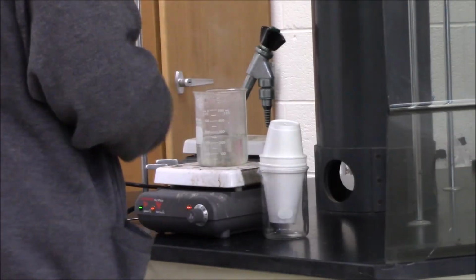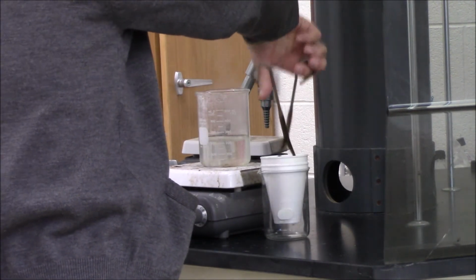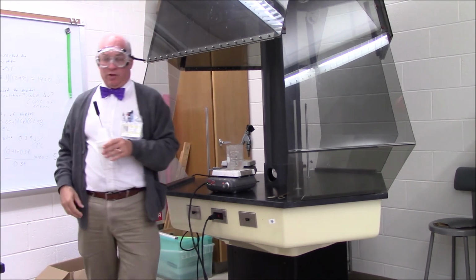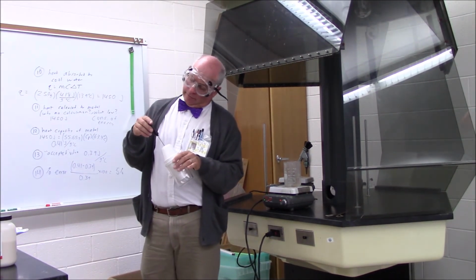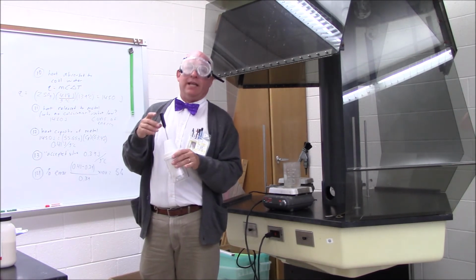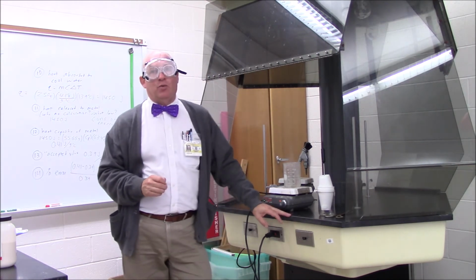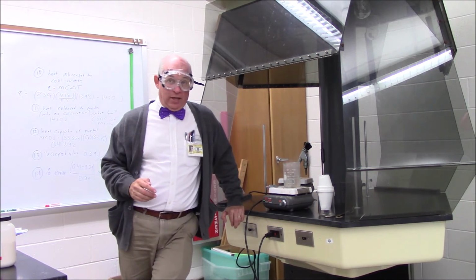I'm going to take this, transfer it from here to here, let it equilibrate or reach a common temperature, and measure the temperature. Remember, the water in the calorimeter was 22.0 degrees when we started. So this is 26.2 degrees. In this case, the metal cooled off a lot and the water didn't heat up very much, and we'll see what that means when we do our heat capacity. Now you have all the data to do your lead calculation.